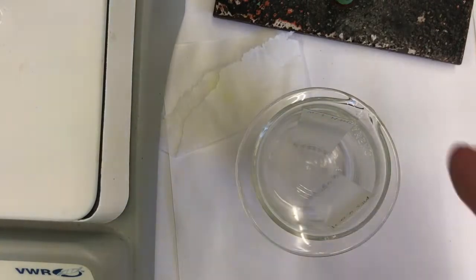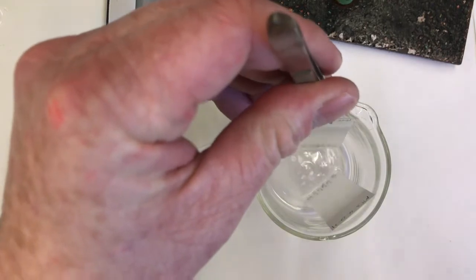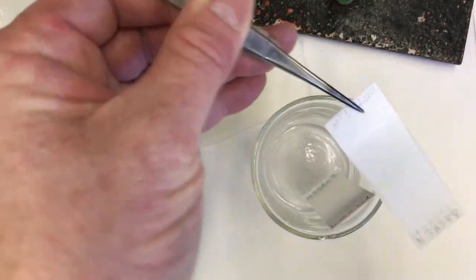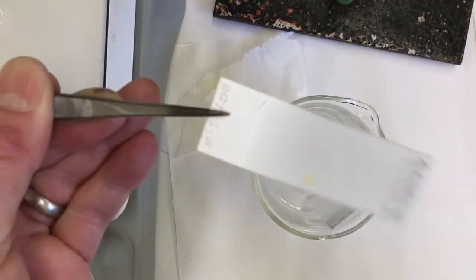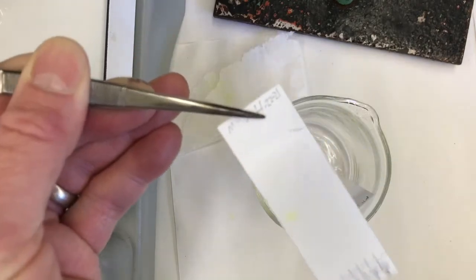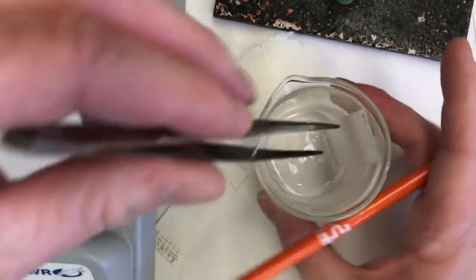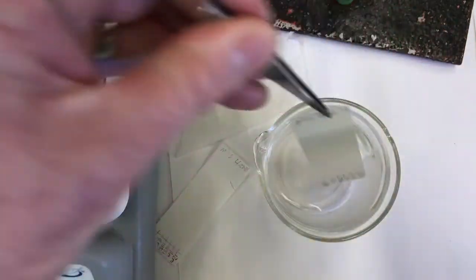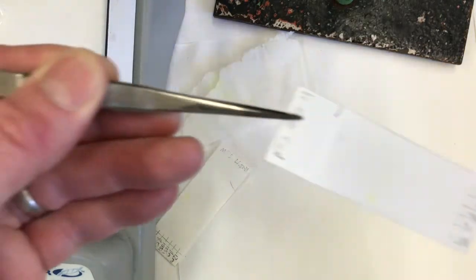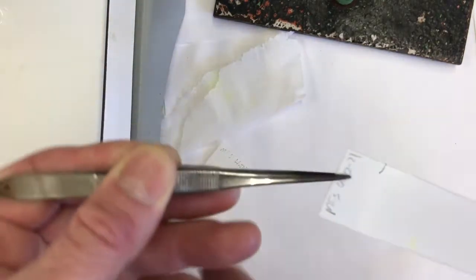Now I will take my TLC plates out and see how they look. So remember, when you pull them out, you want to immediately label the solvent front. Got that one. Shake, shake, shake, shake, shake. Shake it like a Polaroid picture. Okay. Oh, and then drop it. And then this one. Mark that solvent front right away. Shake, shake, shake, shake, shake. Okay.